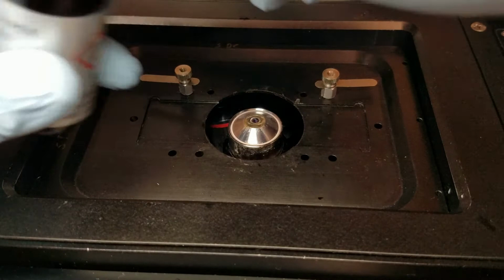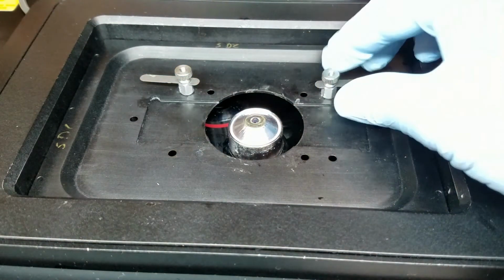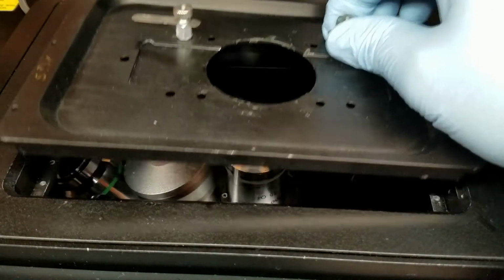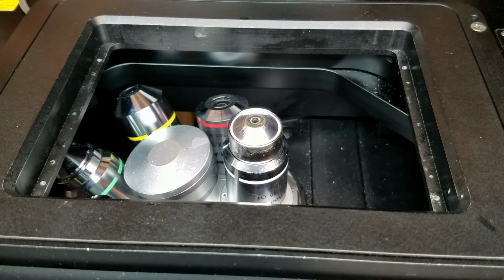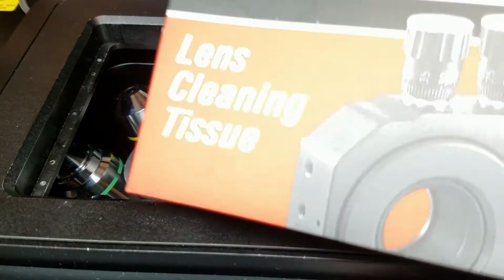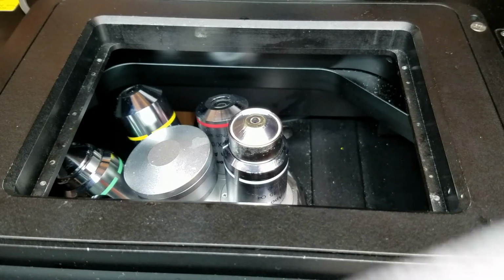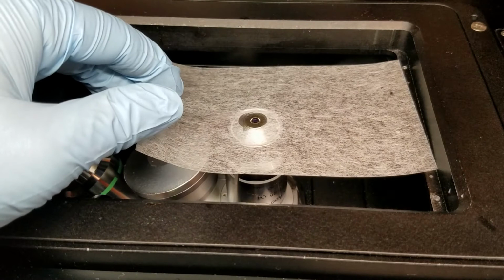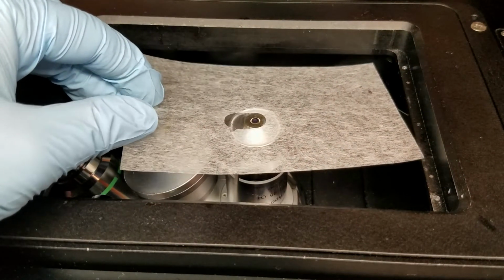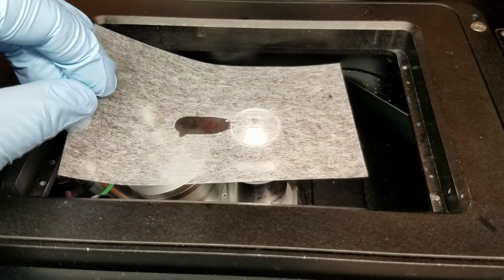Okay. Now, in order to make my life a little bit easier, I am going to remove the stage insert just so I have full access to the objective as so. All right, now what we're going to do, to remove all the oil, again, we get our lens tissue, get it one piece, set it on here like so, give it a moment, and then just start dragging it across. We just want to remove that excess just like that.